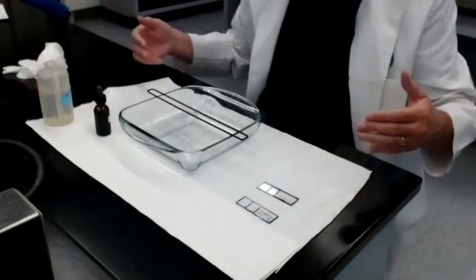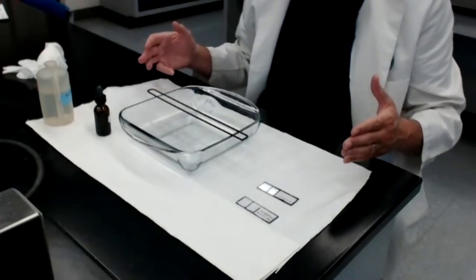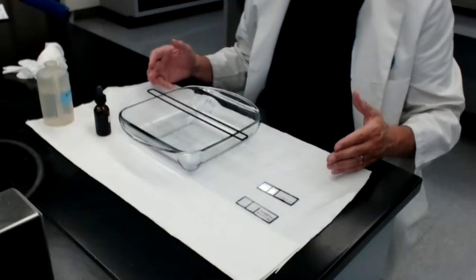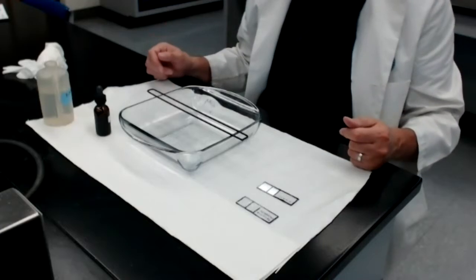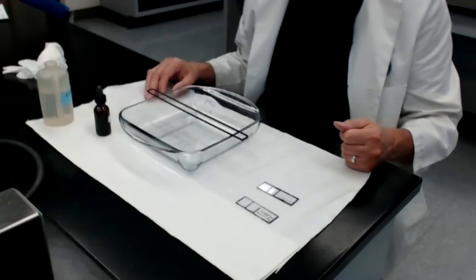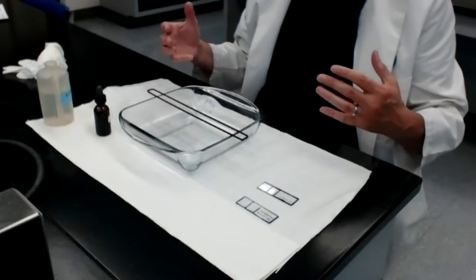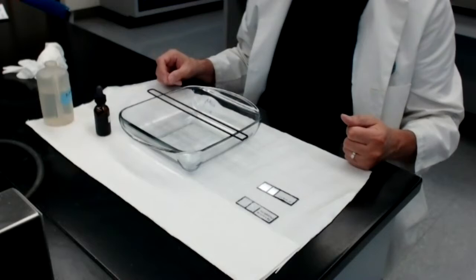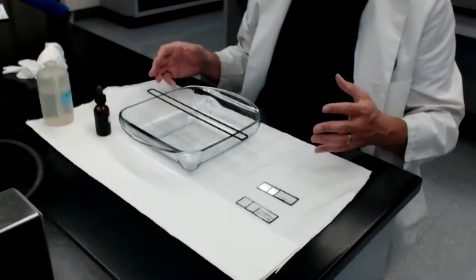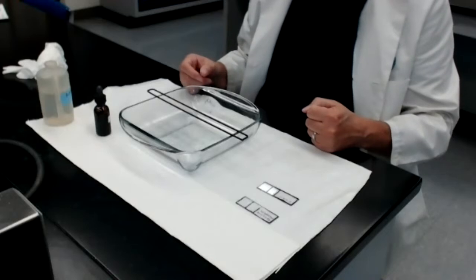So what we have to do to make them easier to see is to give them color. And that's what stains are doing. Staining protocols are techniques designed to give color to the bacterium or to structures that are part of the bacterium. Now, in order to do this, of course, you have to use chemicals that have color, and those chemicals are referred to as dyes. In order to use the dyes, we have to dissolve them in a solvent. The combination of dye dissolved in a solvent is what we call a staining solution.